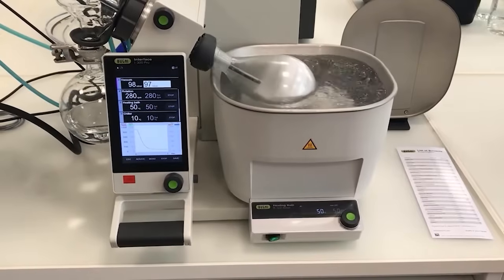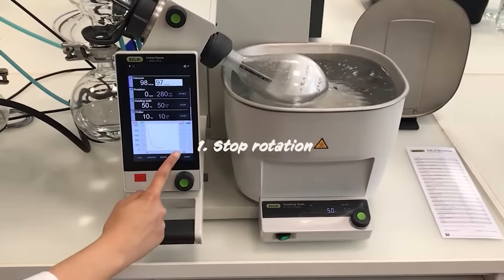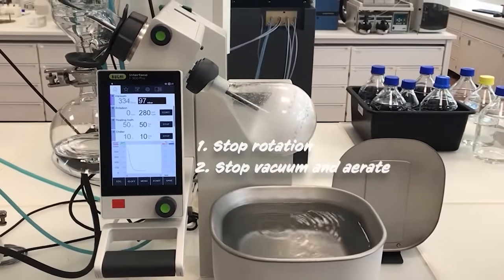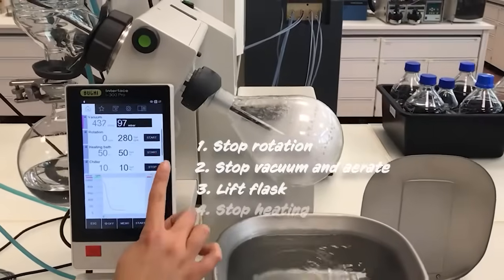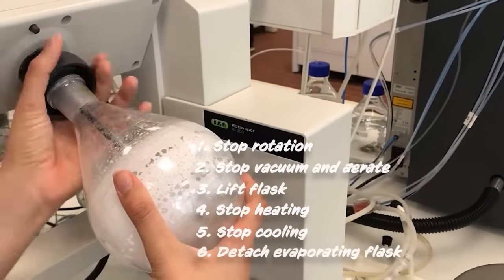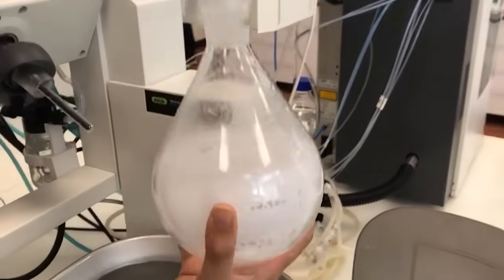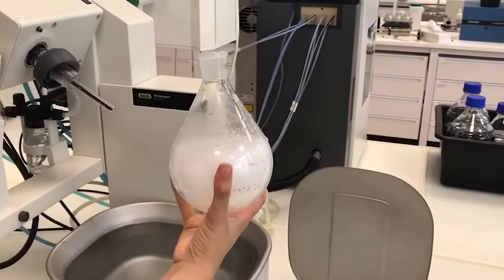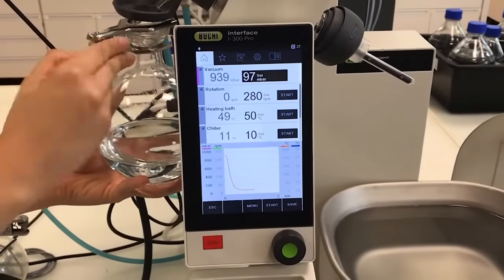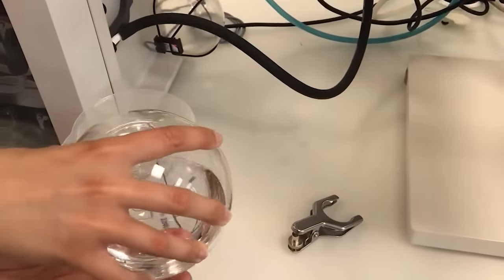Now that our evaporation is over, we need to stop the system. We firstly stop the rotation speed and then the vacuum, and aerate the system until it reaches atmospheric pressure. We then lift up the flask and stop the heating and the cooling. I can now detach my flask, then empty the receiving flask to make sure that our rotovapor will be ready for the next use.